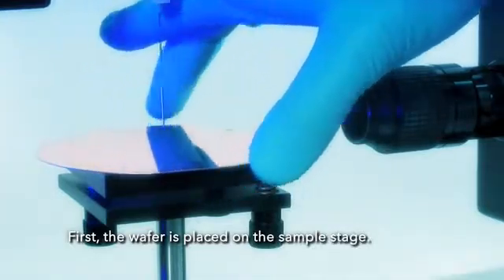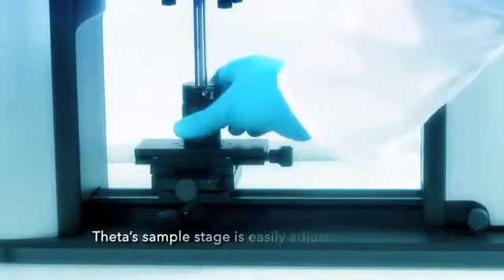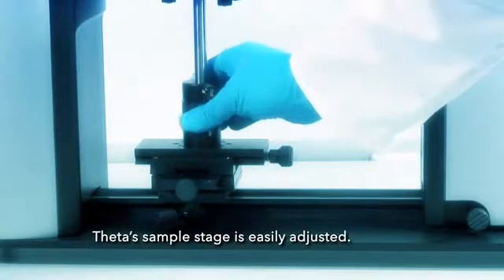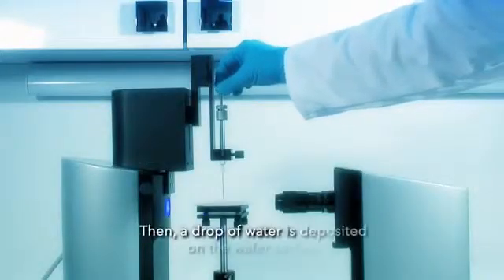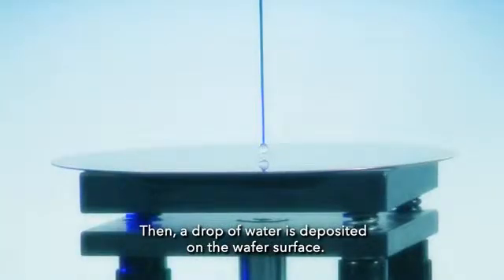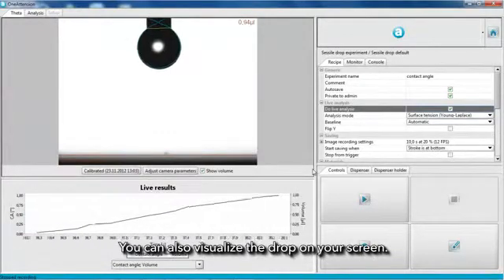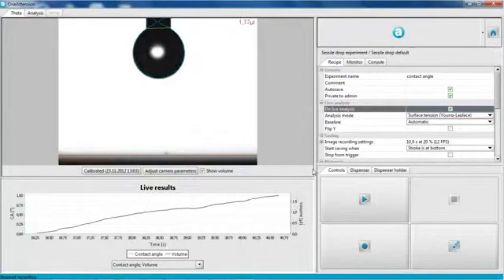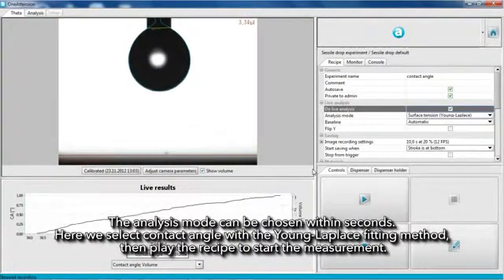First, the wafer is placed on the sample stage. Theta's sample stage is easily adjusted. Then a drop of water is deposited on the wafer surface. You can also visualize the drop on your screen. The analysis mode can be chosen within seconds.